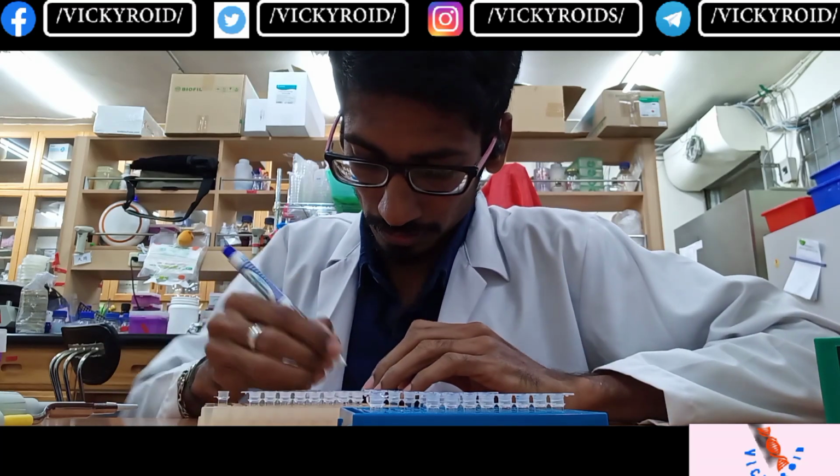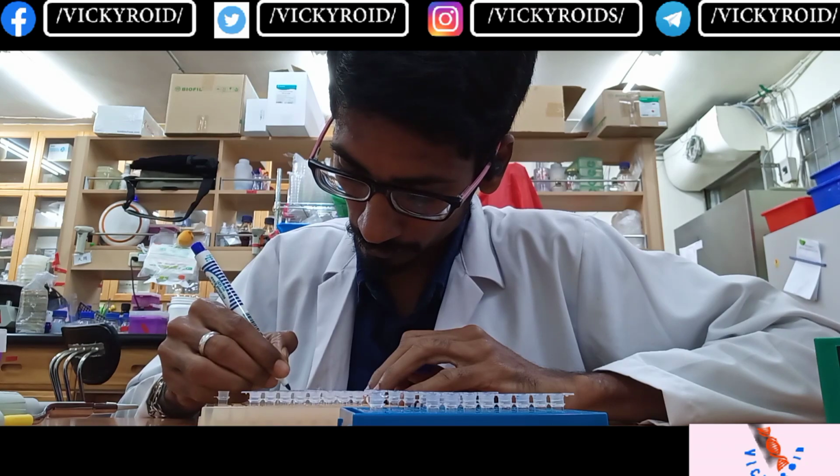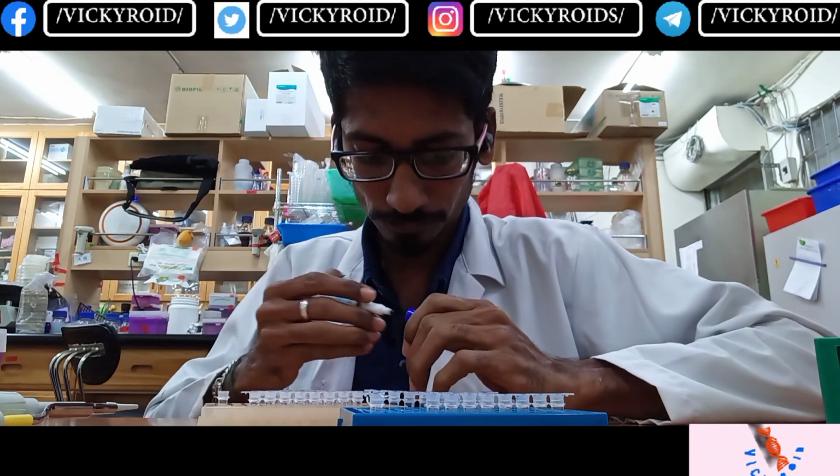So I have added 16 samples now. One more left. Last one.